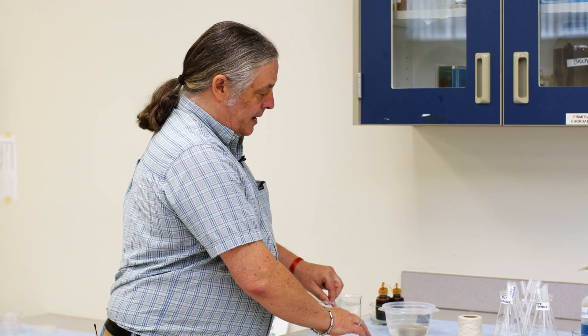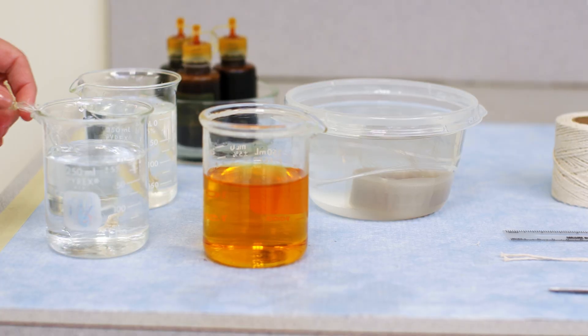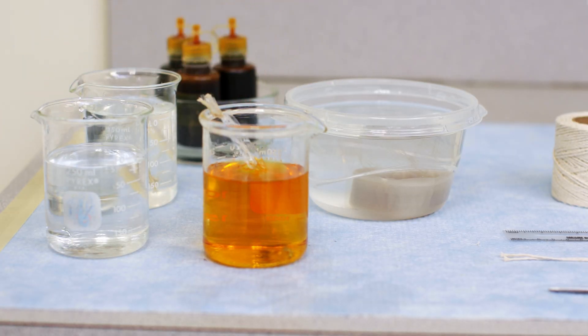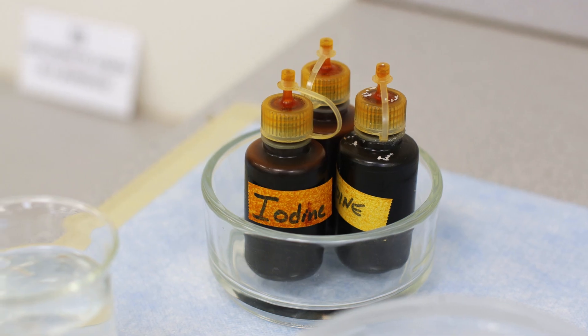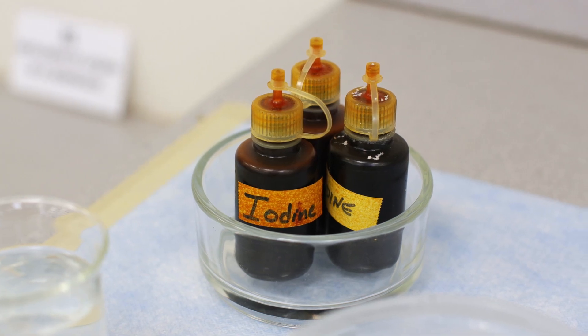Once we have that set up, we're going to place the little water balloon of tubing into a beaker of iodine in water, like you see here, and let it sit for the time period that is instructed for you to observe this in your lab manual.